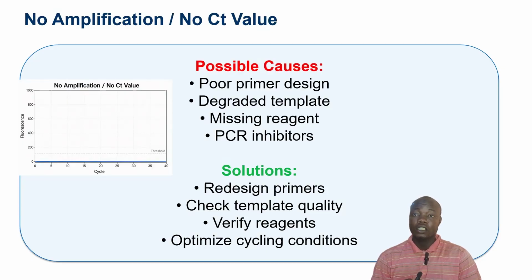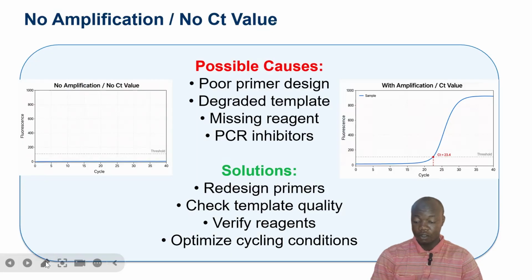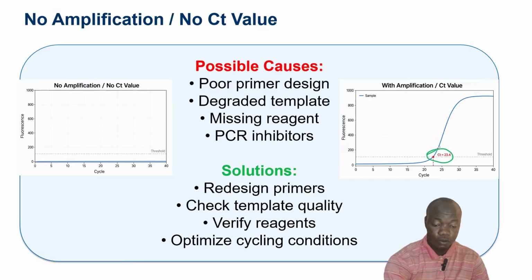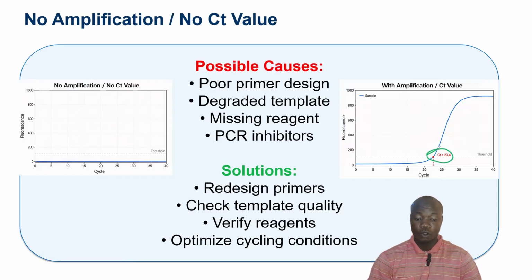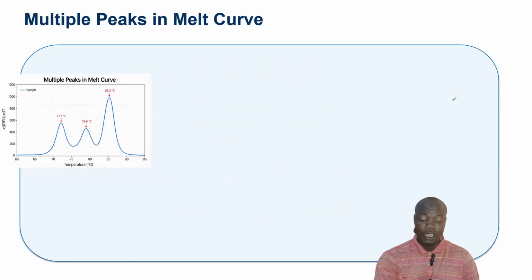If you make this adjustment, probably at the end you are going to have your CT value and amplification, because, as you can see from here, this is a typical result where we have a CT value slightly above your threshold, and this is of course the amplification. So ladies and gentlemen, whenever you are doing qPCR, make sure you have a perfect primer, you have quality template, then you verify your reagents. Make sure each of the reagents is active, and then you also optimize your cycling conditions.